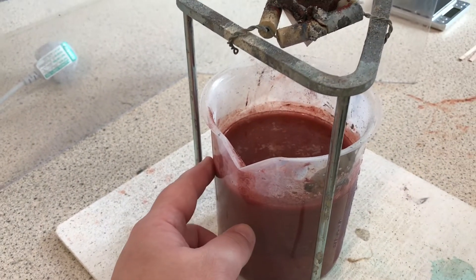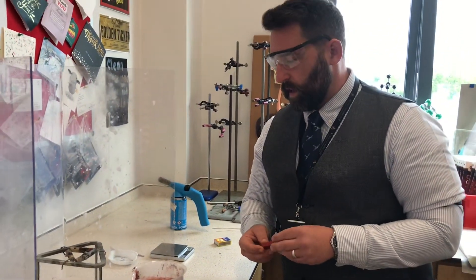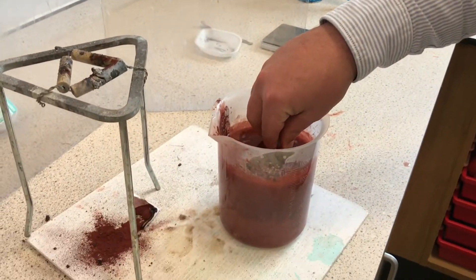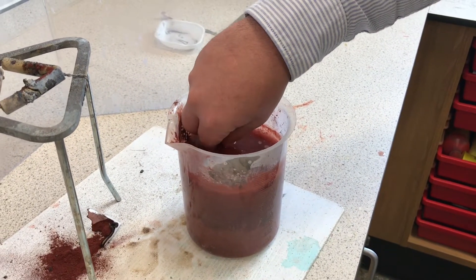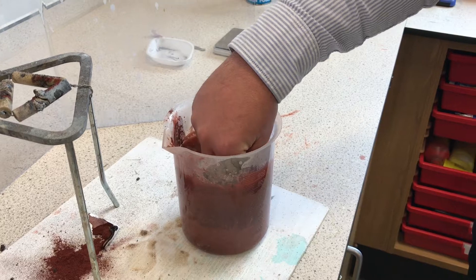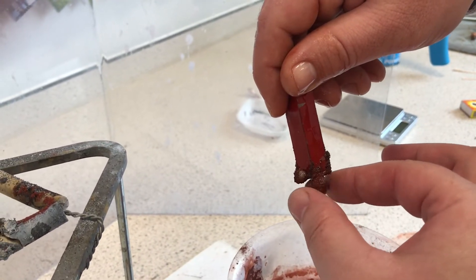It landed in the sand as we said. We're now going to see if we can get our lump of hopefully pure iron out of there — for that we'll need a magnet. We should have a tiny lump of iron from that reaction that we should be able to pull out with the magnet. Let me go searching for it. We'll get rid of some of the water — oh, there it is! Well done, look at that.